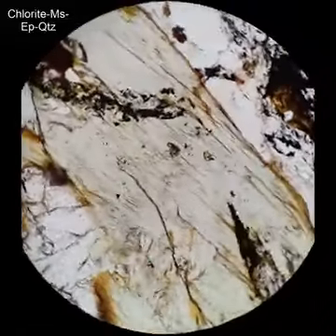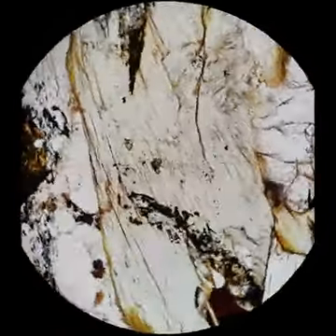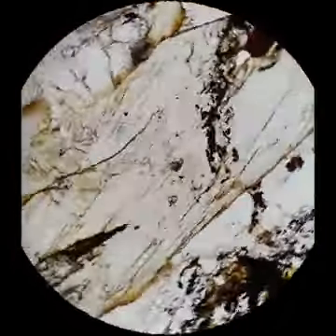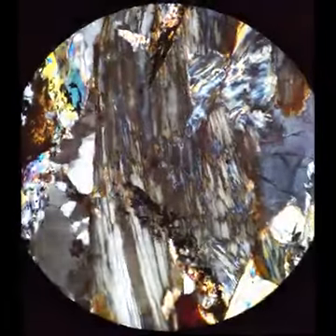Now this is a really interesting chlorite. It's got the same green light pleochroism of all chlorites, but when you cross the polars, what you'll see is it has two different anomalous interference colors. There's this sort of brownish greenish color, the khaki color, and there's also that anomalous blue color. It's unusual to find them both in the same crystal.